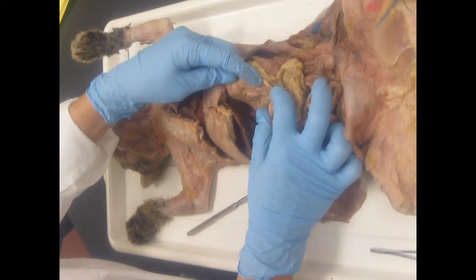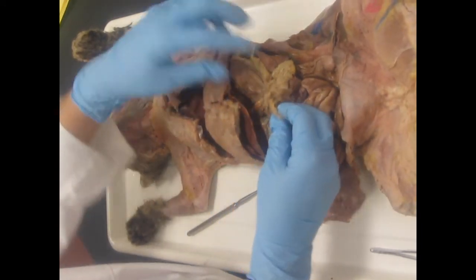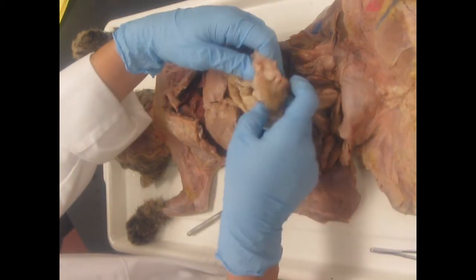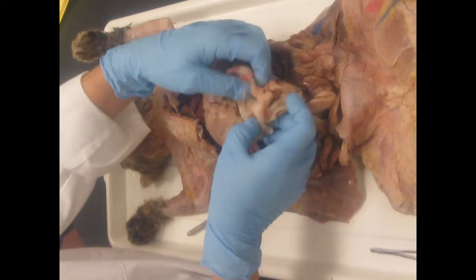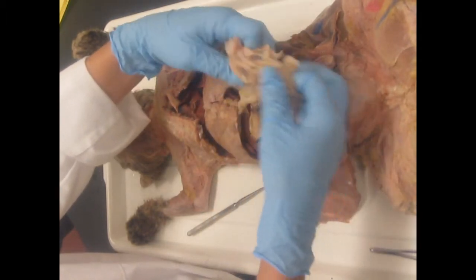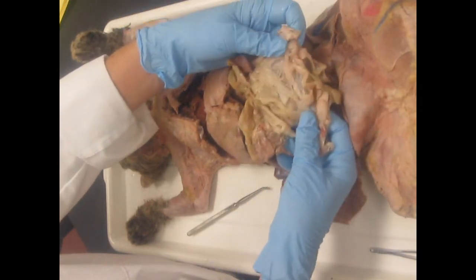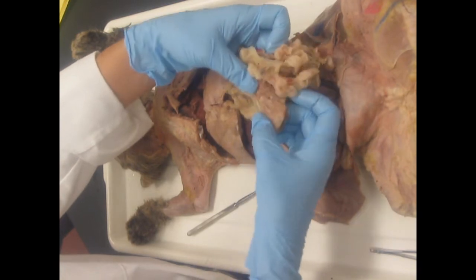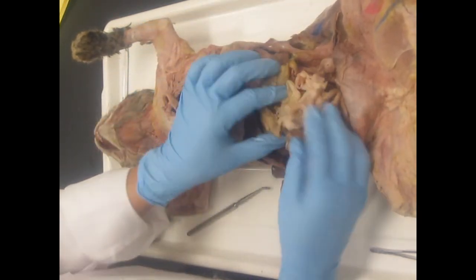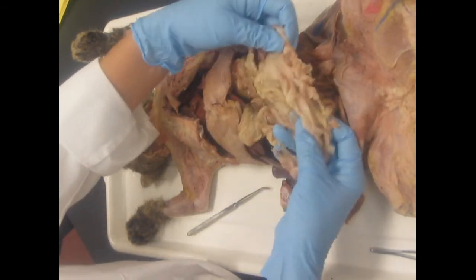Okay, there it is. Now, along the greater curvature is this thing that looks like fat. But it's actually a membrane that can fill with fat. And if you gently unravel it, you might have to unravel it from around some intestines and things. I did that when I washed out the cat. Okay, this great big membrane is the greater omentum. And this is the one that is going to try to wrap itself in and around the organs, and if there's ever a puncture to the organs, it would seal that and help clot.